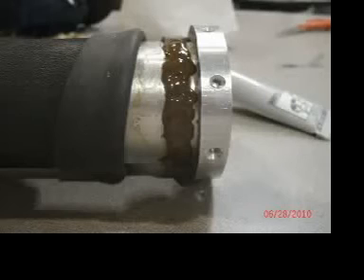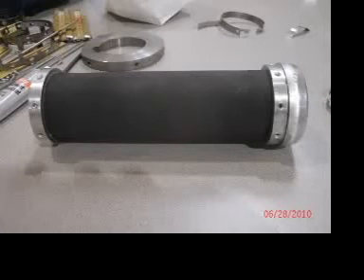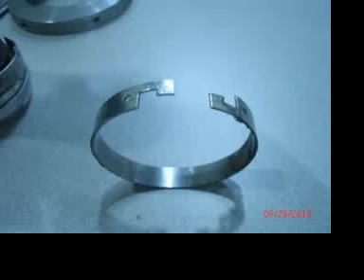There are other things that you could possibly use. I do not recommend using silicone, nor do I recommend using a non-hardening sealer like Permatex number 2. You do not need as much sealer as is shown in these pictures. You need barely enough to cover the ribs at either end. This is too much sealer, and what it will do is when you've got the leaves on there, it'll make the bladder stick out too far. It'll make it hard to put cores on the machine.